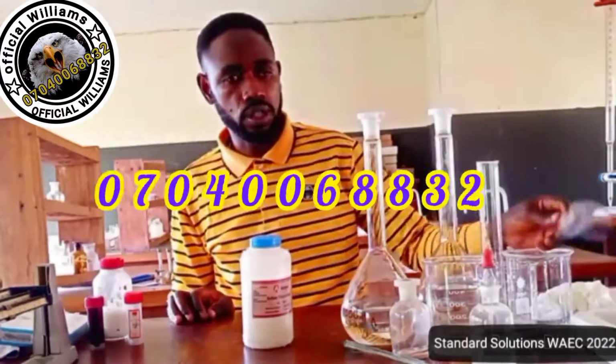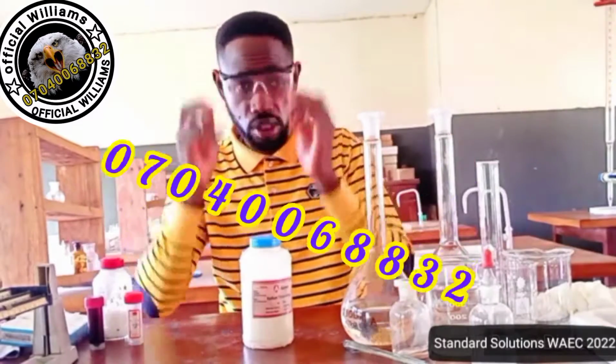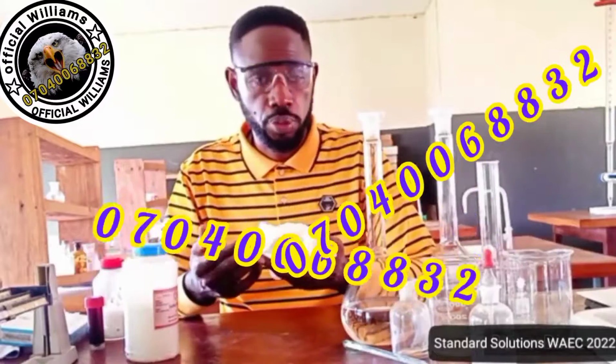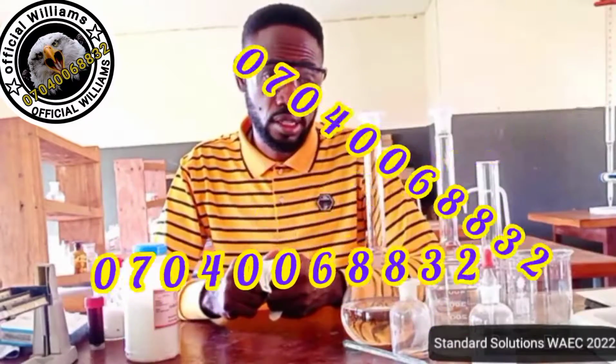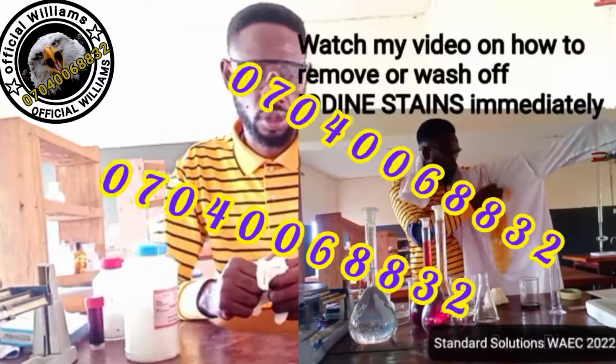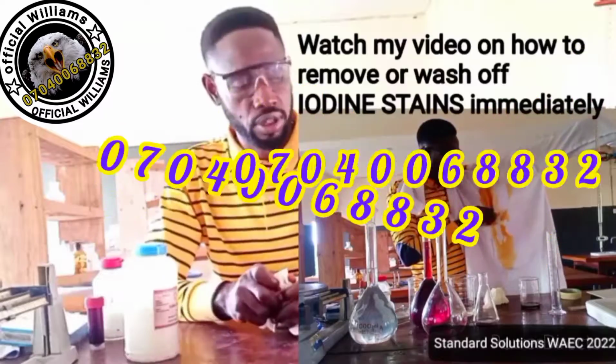Now, don't forget that you need your safety wear. First, you need your safety goggles. A good teacher should lead by example. Then you need your hand gloves to protect yourself, especially against iodine. It's volatile and it causes stubborn stains on any material it comes against. Then you also need your laboratory coats.